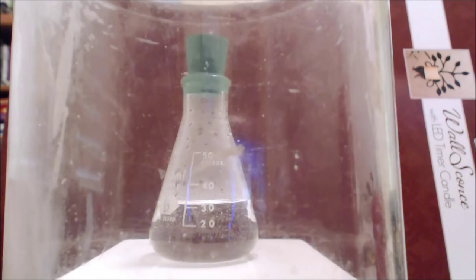Hello. Today I'm going to demonstrate what happens when you heat a liquid in a closed container. I have an Erlenmeyer flask with some water in it, stoppered tightly with a rubber stopper, and I'm heating it on a hot plate. And so we'll observe what happens.